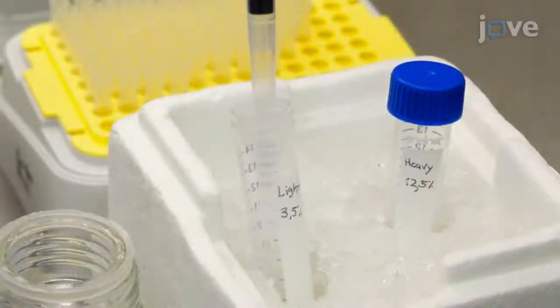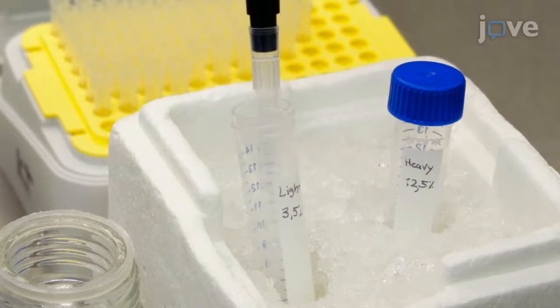To prevent untimely polymerization, keep the centrifuge tubes on ice while preparing the solutions.